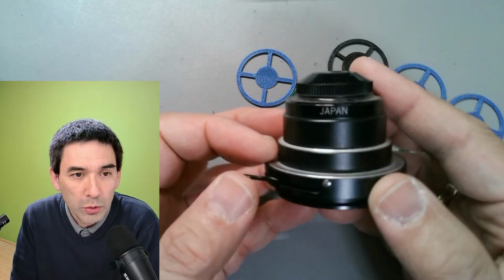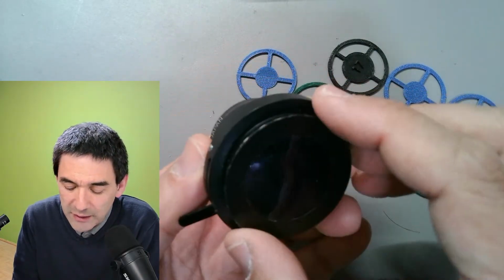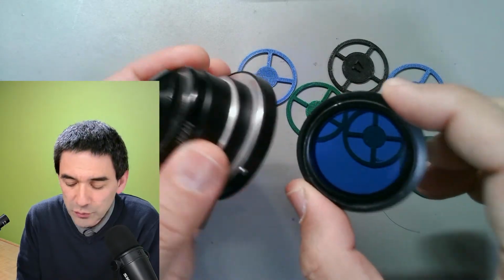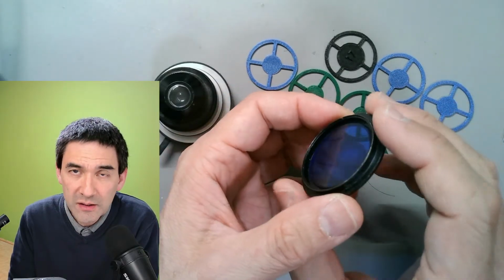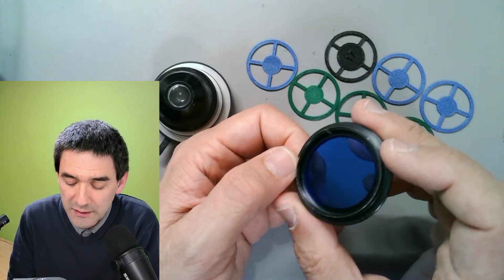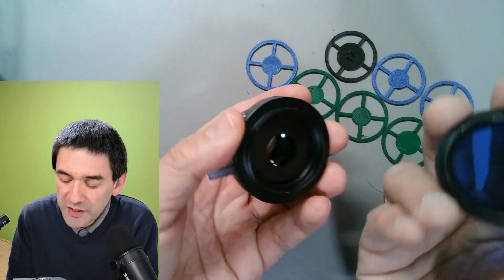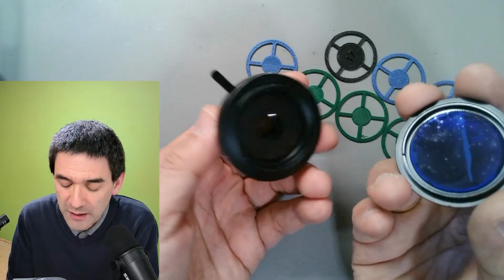What I got here is a condenser from an old Olympus microscope, and I just took it because I had it here, right? And down here we have a so-called push-on or pop-on filter. You see it's a blue filter, and the reason it's blue is that the microscope was a microscope with halogen light. Halogen contains a significantly more red component, and the blue filter gives it more of a neutral color, and also a cooler color, so it also filters away somewhat of the heat radiation. And this is a pop-on filter, and you can put it on here.